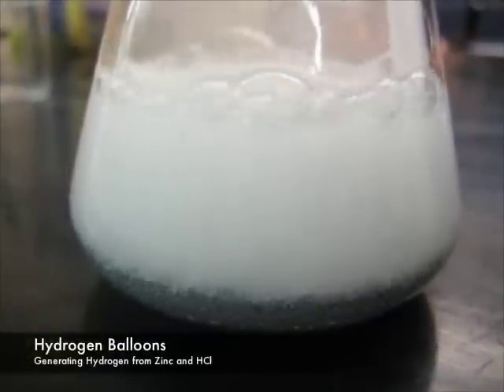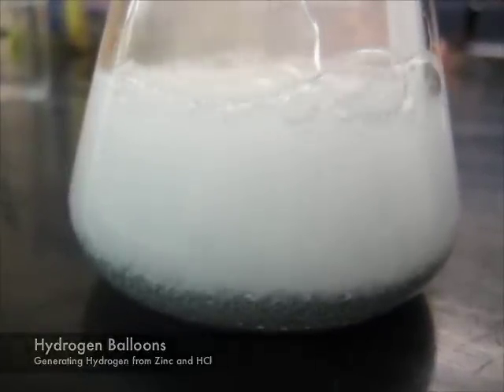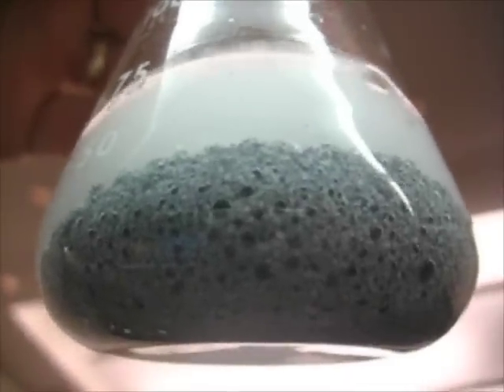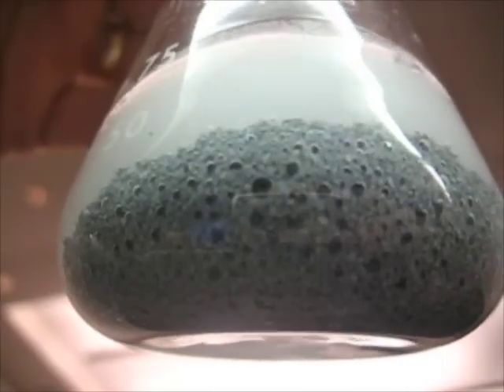Hydrogen balloons. We're generating hydrogen using zinc and hydrochloric acid. Here are several views of the zinc reacting with hydrochloric acid.